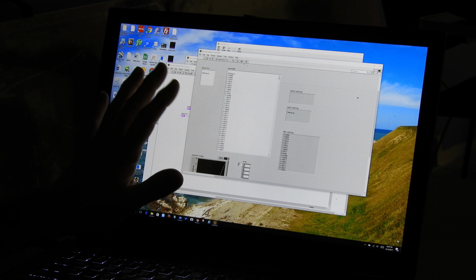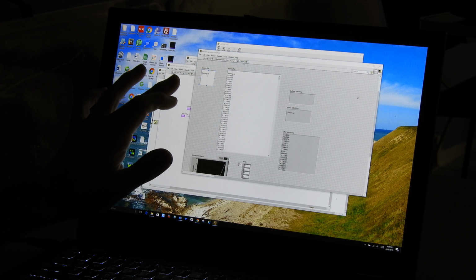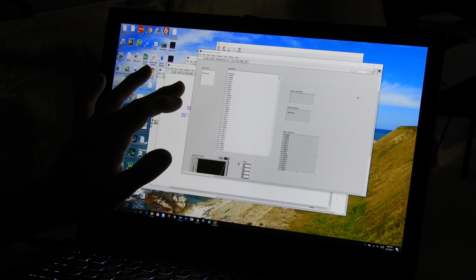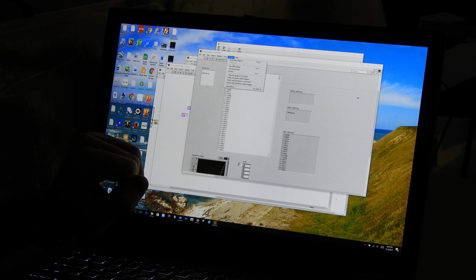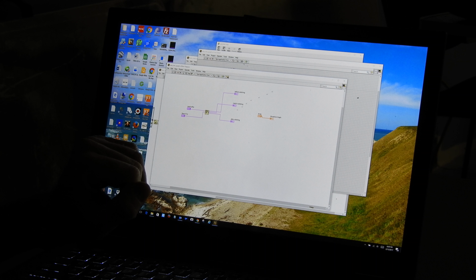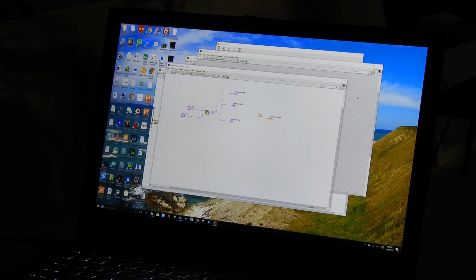Okay, so long story short, I figured out a better way to copy this out of the beginning here to get rid of the beginning, and now I've got my after substring starting at the very beginning, the 0 one. And so now we're going to want to parse this substring. So let me go back to my code and solidify what we did.